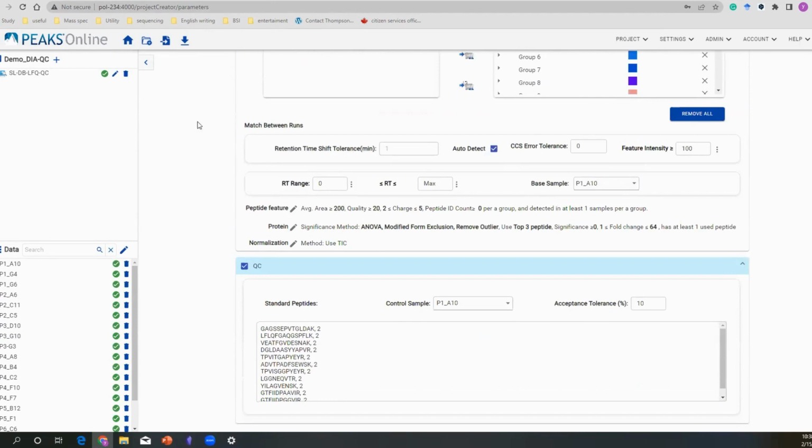So at the end of all these setup parameters, you can simply check this QC box to activate this function. So you really don't have to do anything extra to start this process. And for the control sample, you can select any sample you would like to use as a benchmark, or if you don't have a perfect one, you just want to have an idea about how things behave, you can even select your average sample. For the accept tolerance, it's changeable. You can type in the accept tolerance, or if you like, you can use the arrow to change up and down your accept tolerance.